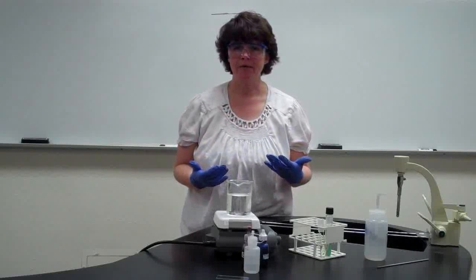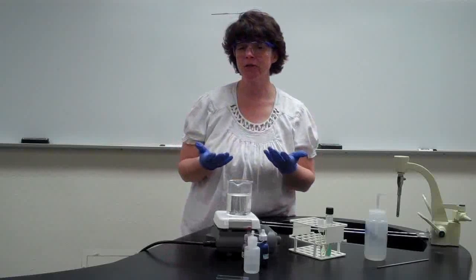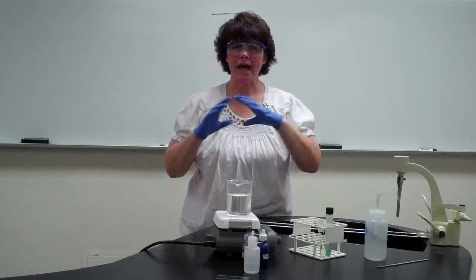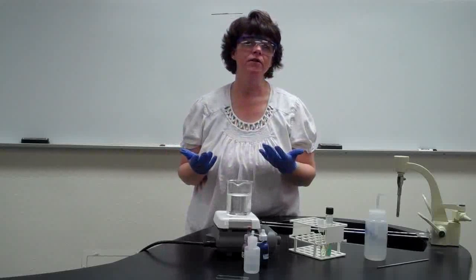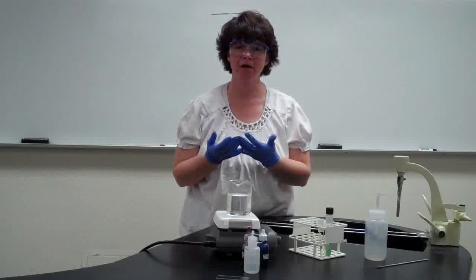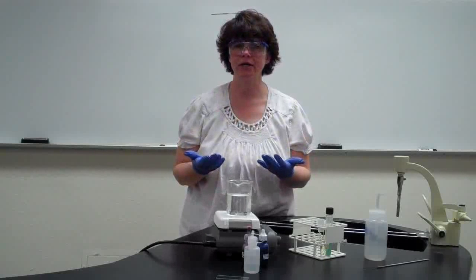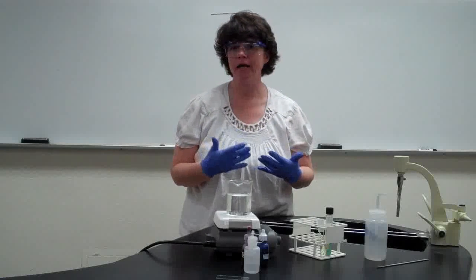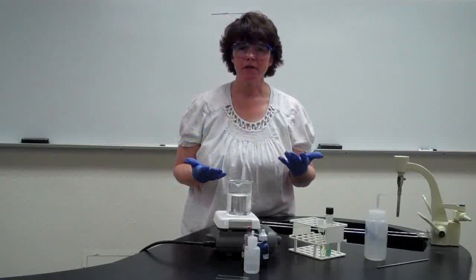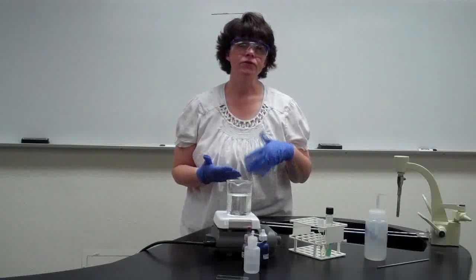These two bacteria have their normal peptidoglycan cell wall like you would see with any other bacteria, but then outside of their peptidoglycan wall, they have a waxy coat, and that waxy coat is called mycolic acid. And that mycolic acid helps protect those bacteria so that they can invade the body and get through the defense mechanisms.